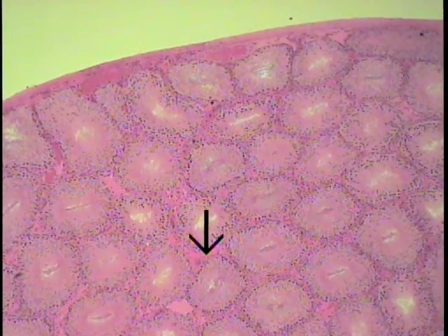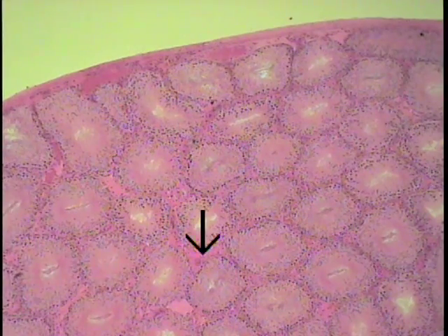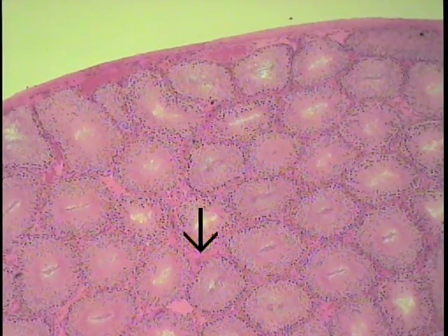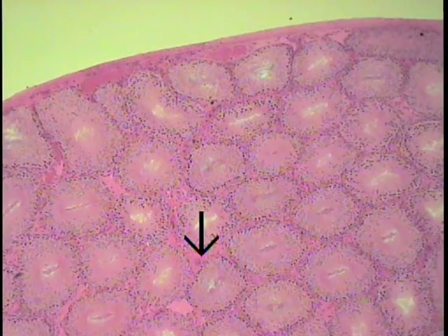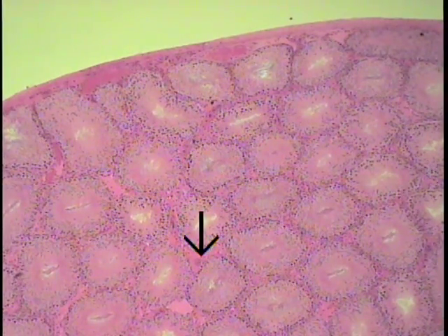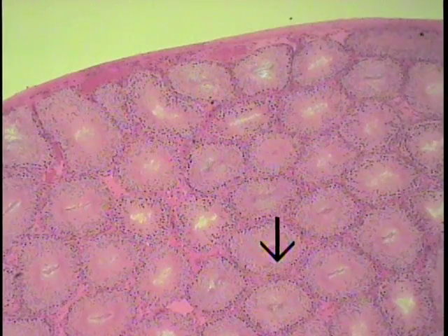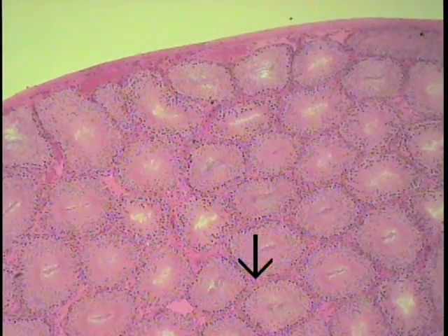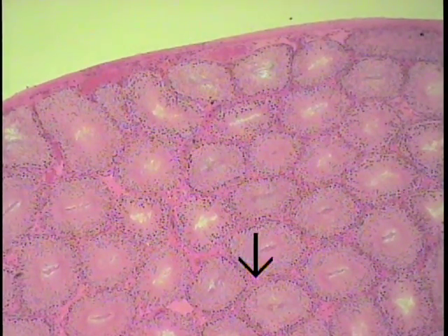In between seminiferous tubules, and indicated by the pointer, is the interstitial tissue. This delicate connective tissue, rich in vasculature and lymphatics, will contain an important cell type known as the Leydig cell, or an interstitial cell.